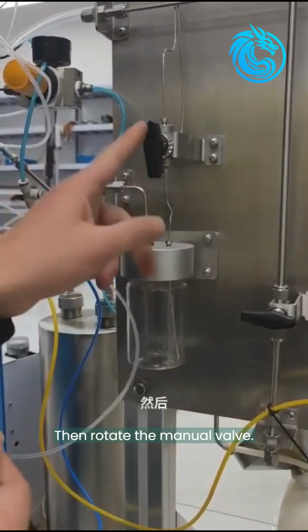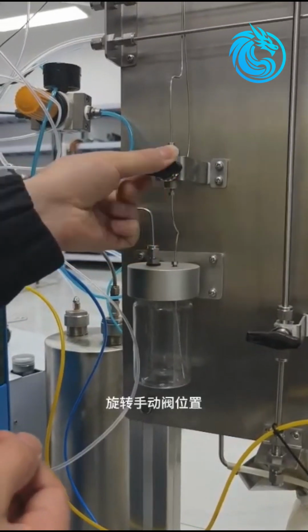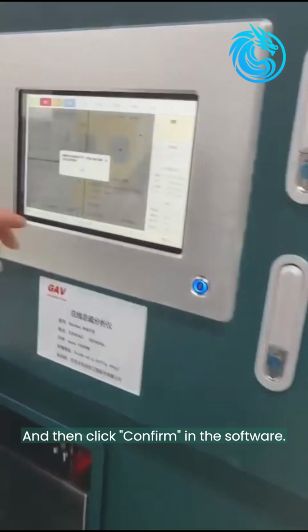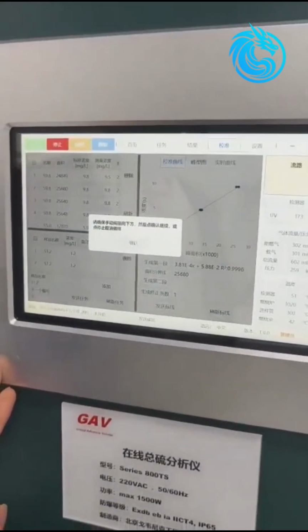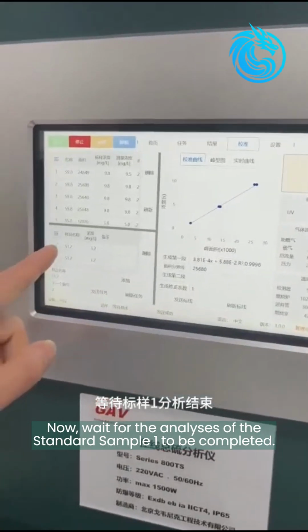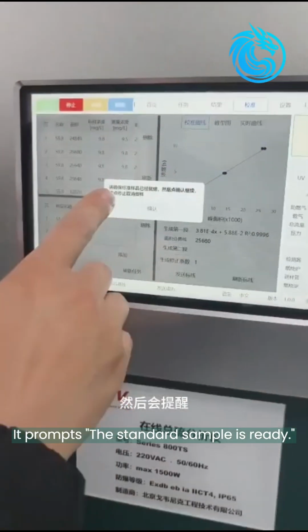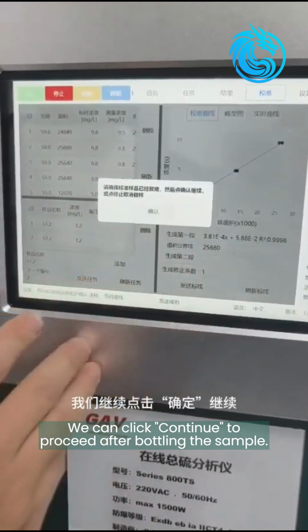Then rotate the manual valve. The arrow points downwards, indicating to prepare a standard sample. And then click Confirm in the software. Now, wait for the analysis of the standard sample 1 to be completed. It prompts the standard sample is ready. We can click Continue to proceed after bottling the sample.